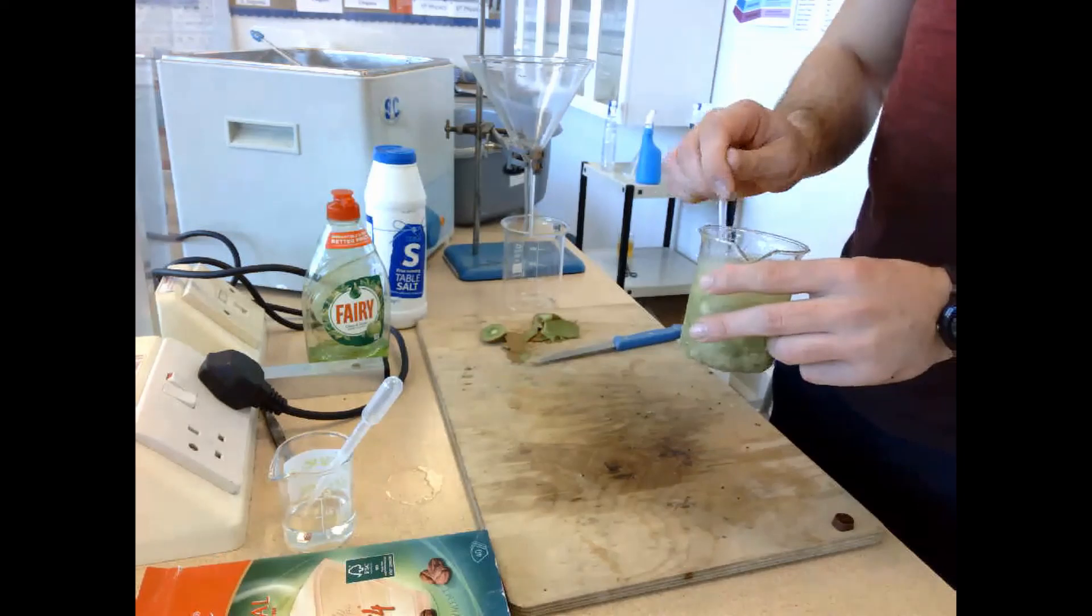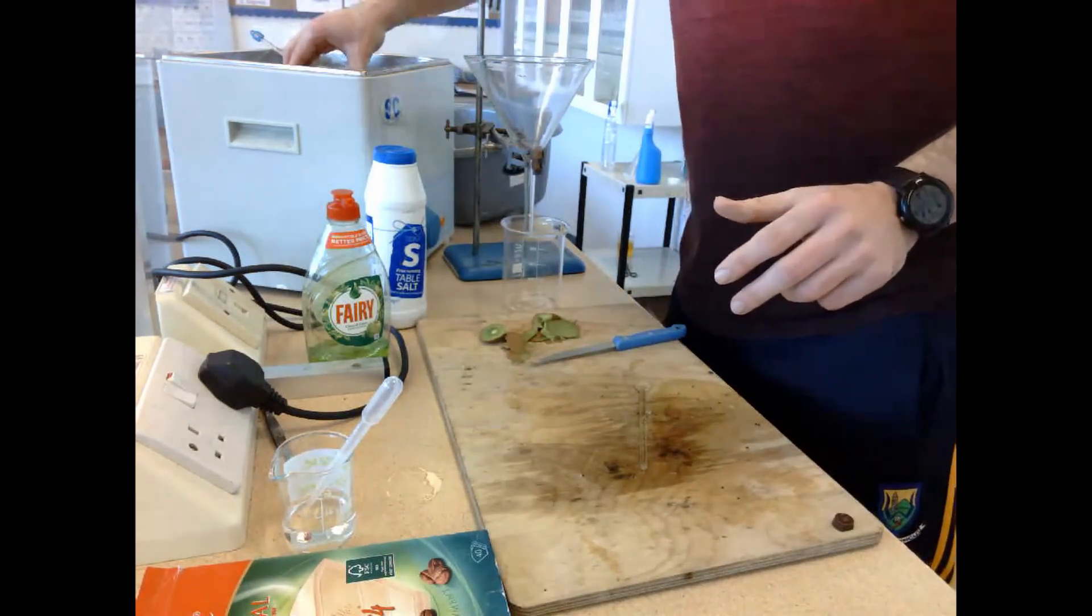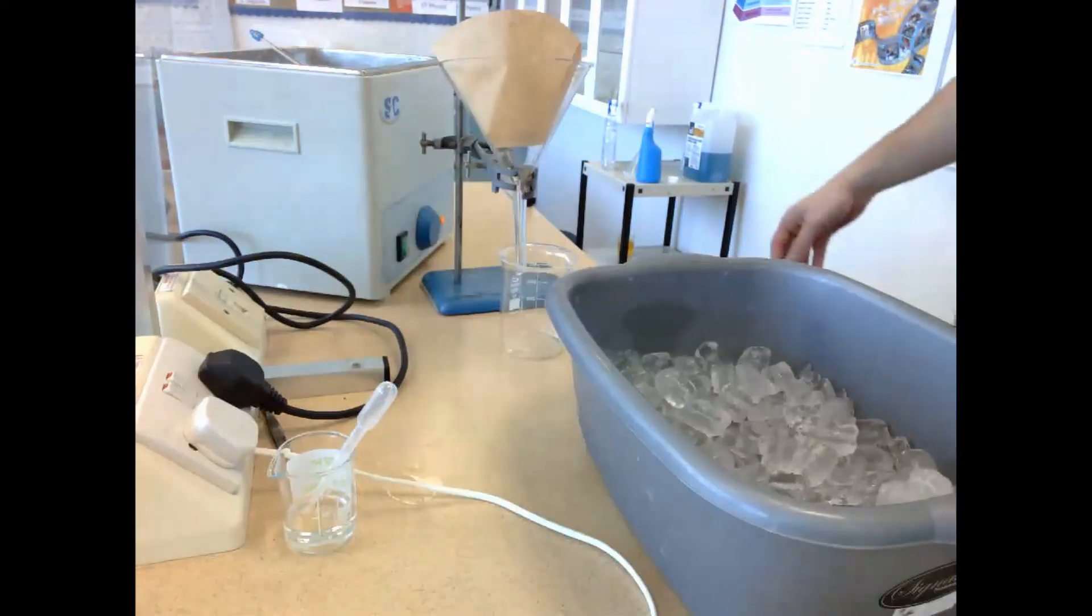Now we leave it in this water bath 15 full minutes, but we do not leave it any longer than that, because if you were to leave it longer than 15 minutes, the DNA itself would begin to break down.